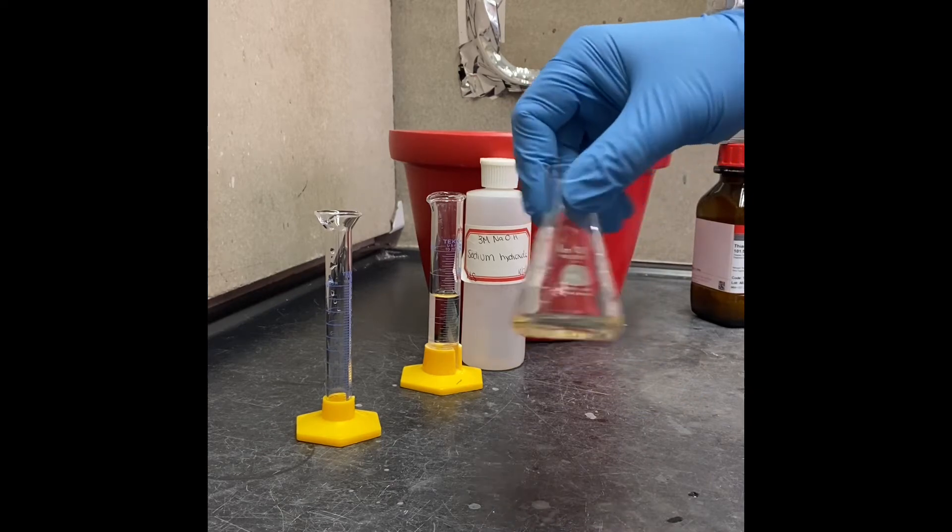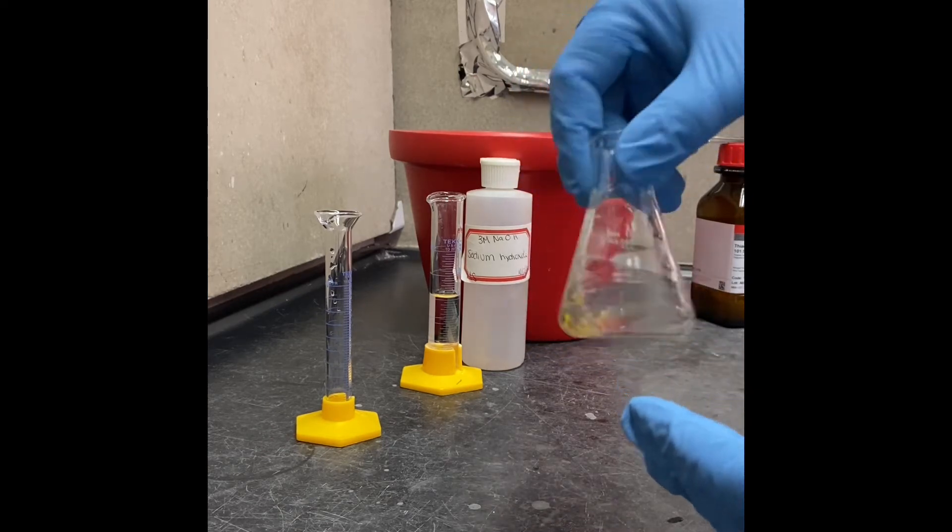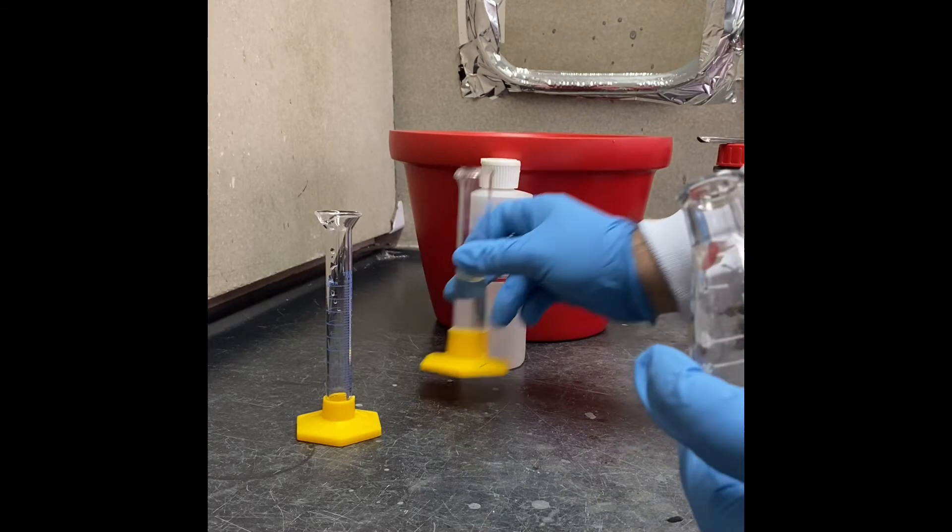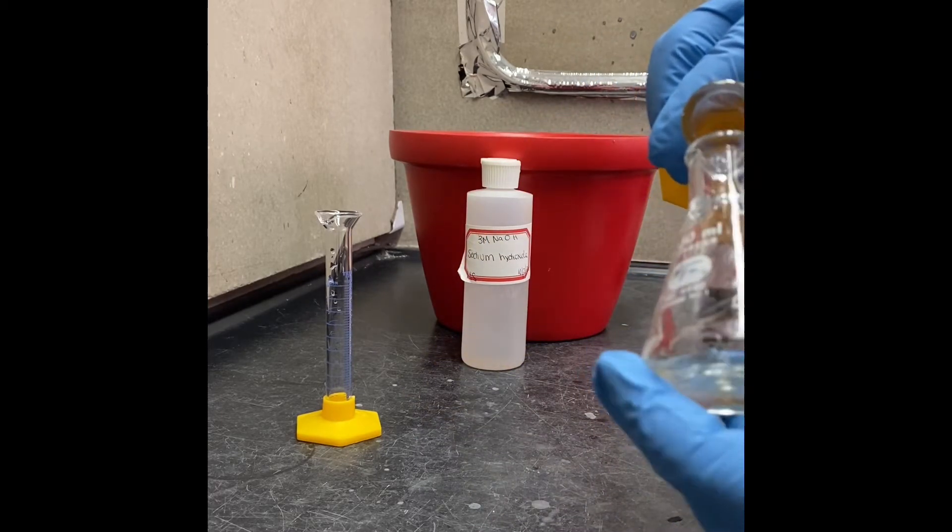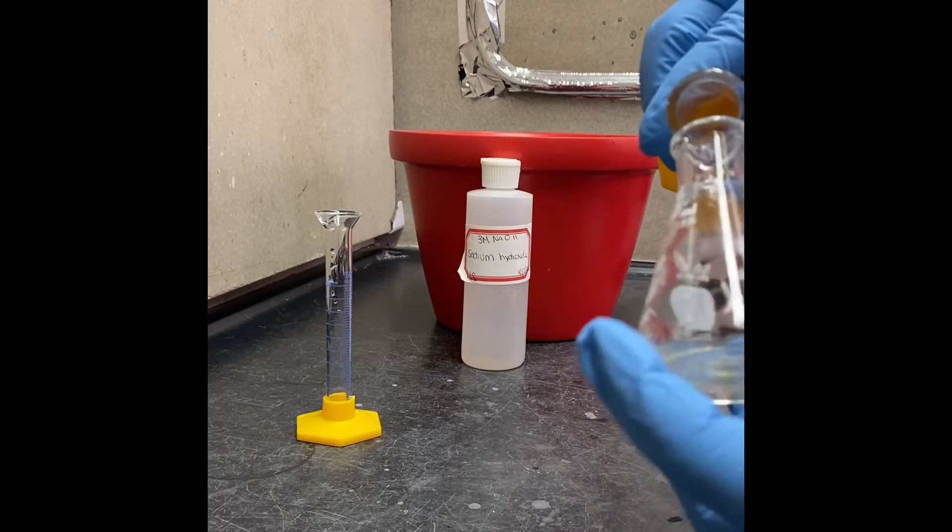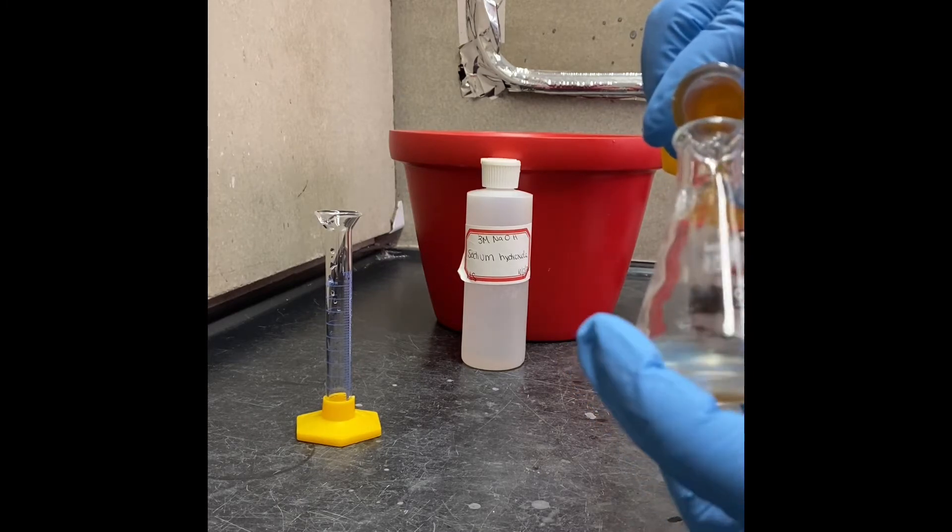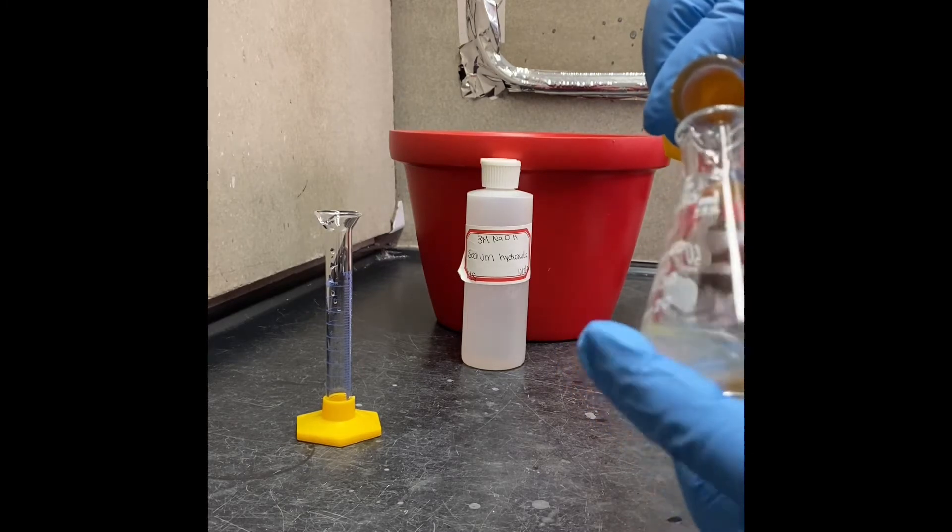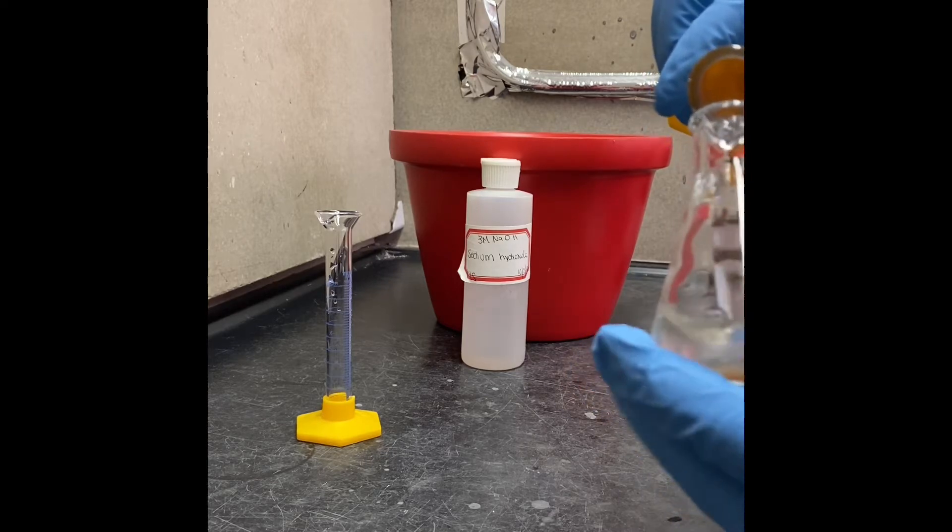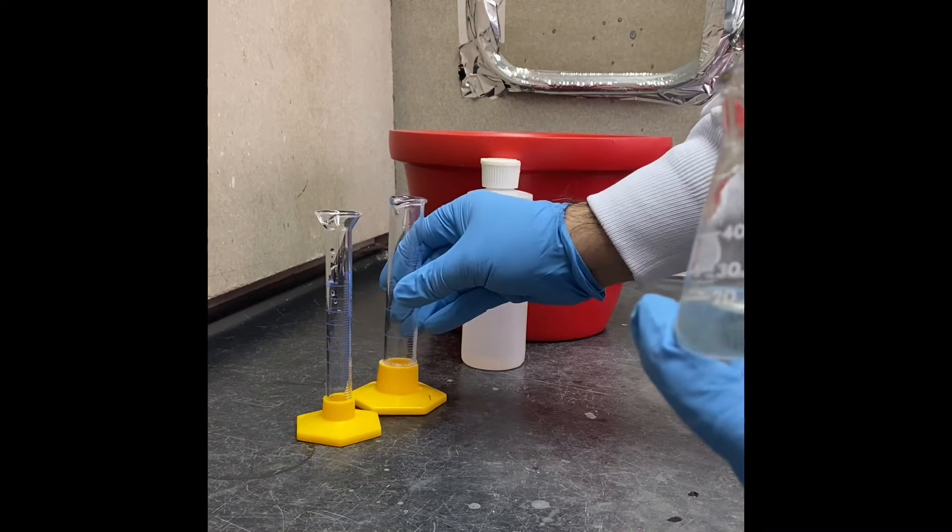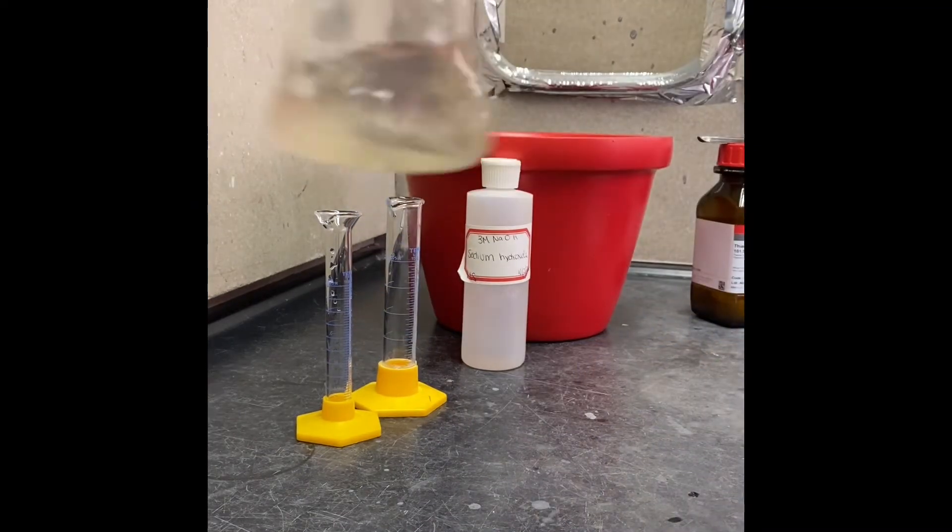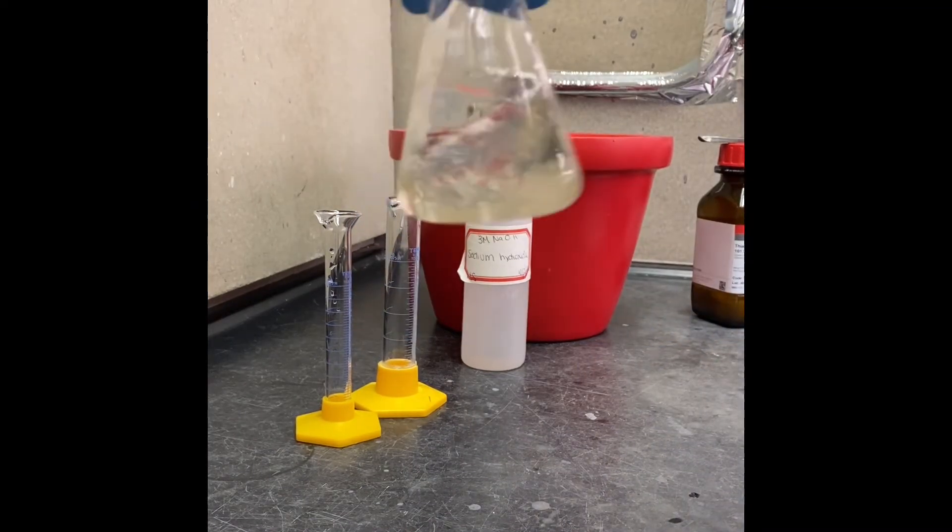Since it's a salt, it's going to dissolve right away. And then we're going to add 15 milliliters of ethanol. That's our solution.